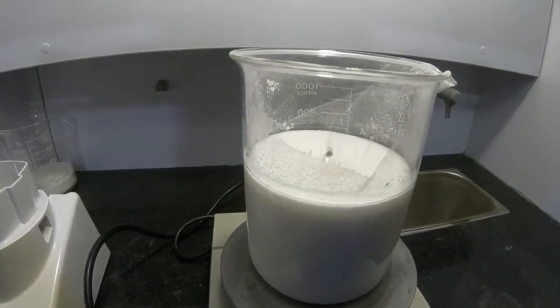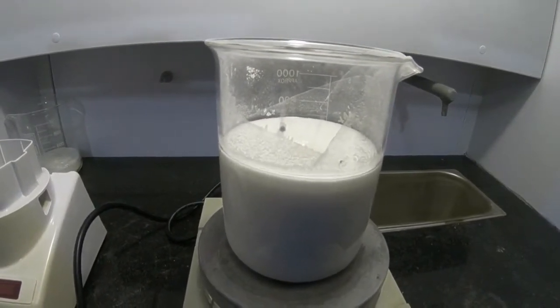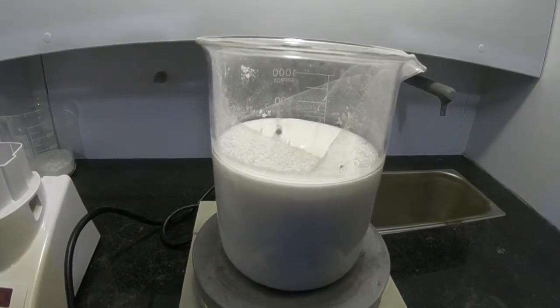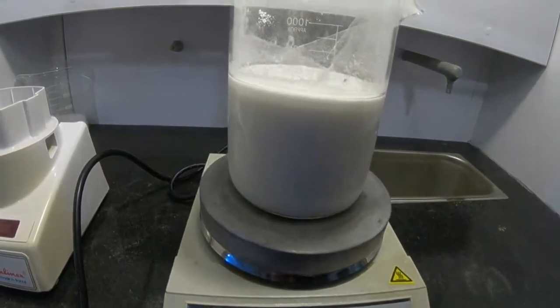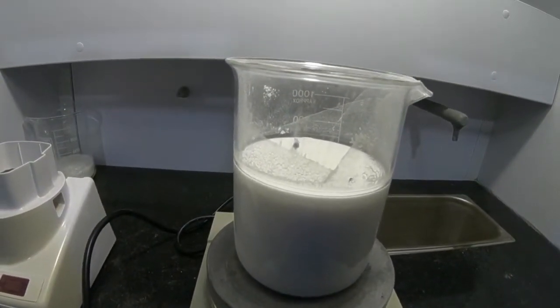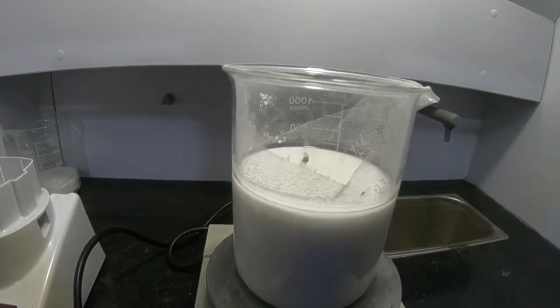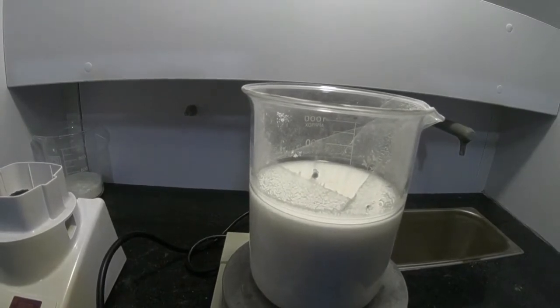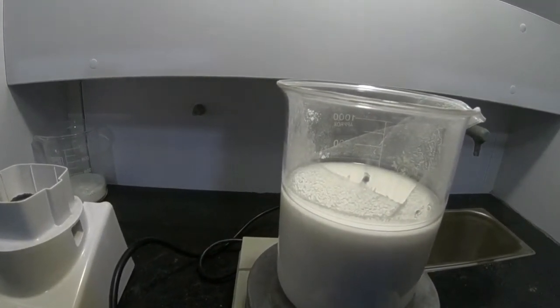Then the concentrated product will be crystallized from the mixture of ethanol and water. It has been around one hour since I started stirring the mixture. So I am going to turn off the stirrer and let it settle down, and then I am going to decant it or filter it.